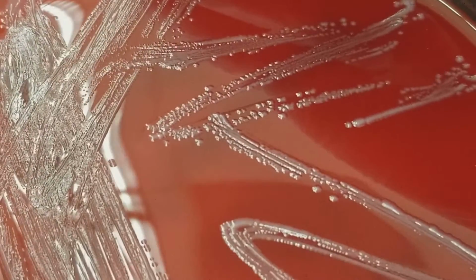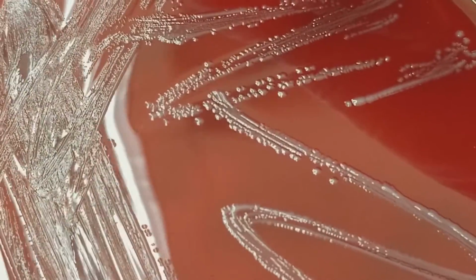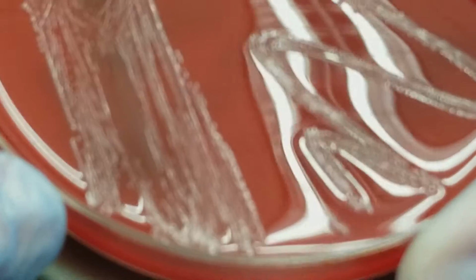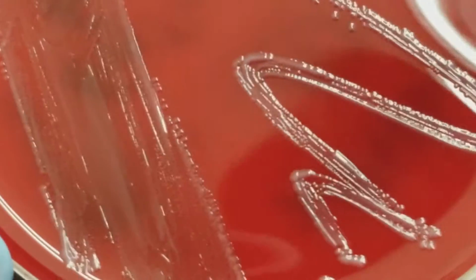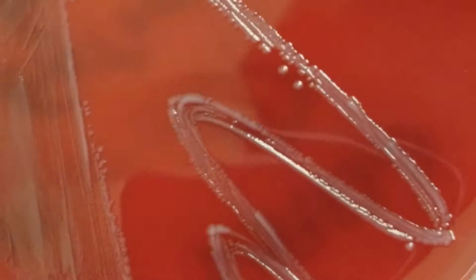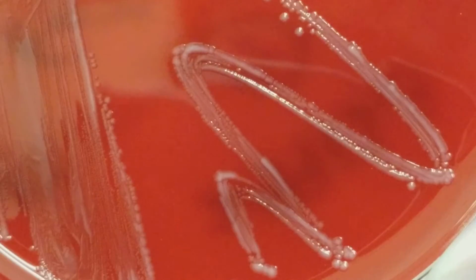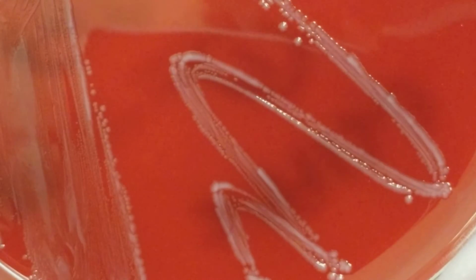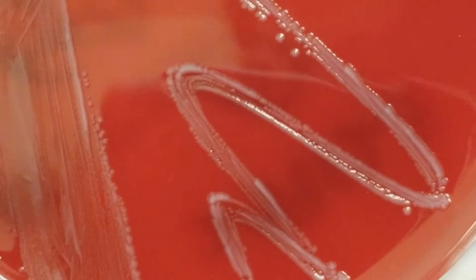So this is Enterococcus faecalis, okay, and this is from the gastrointestinal tract, as we just said. But notice it does look different from the staph that we saw on that other culture. Okay, it is kind of grayish or lacking in color, depending on where exactly you look. Usually strep ends up being a smaller type of colony than staph, and Enterococcus kind of falls in between.